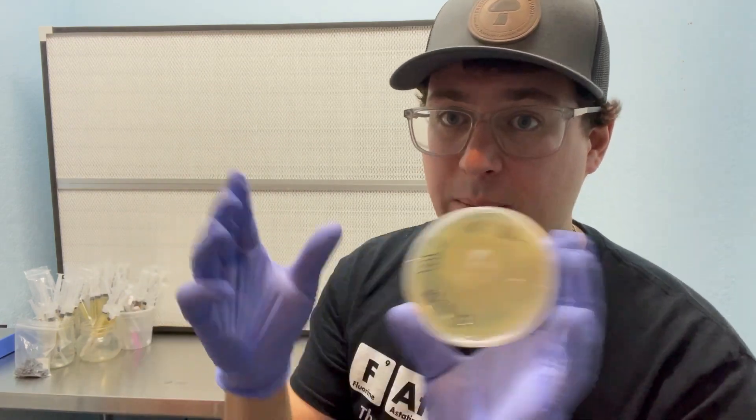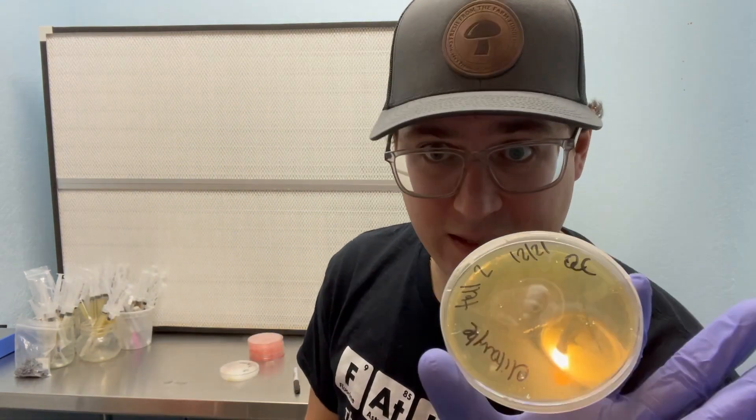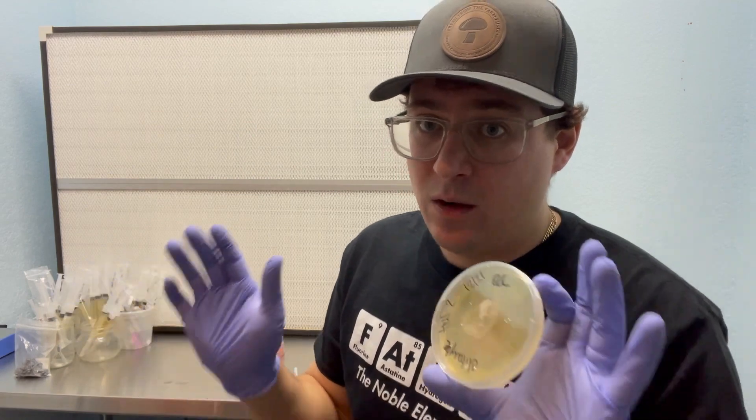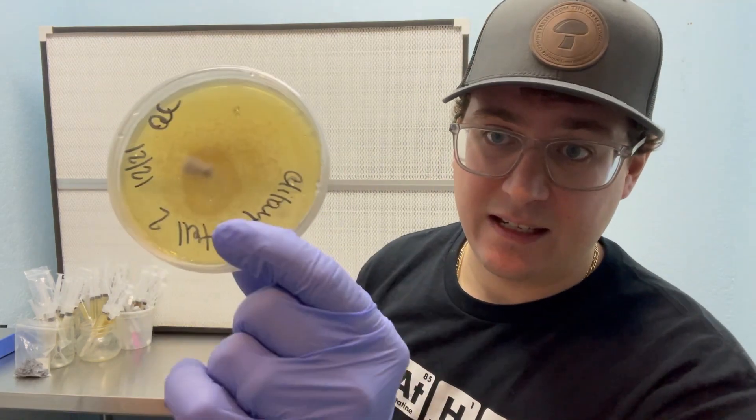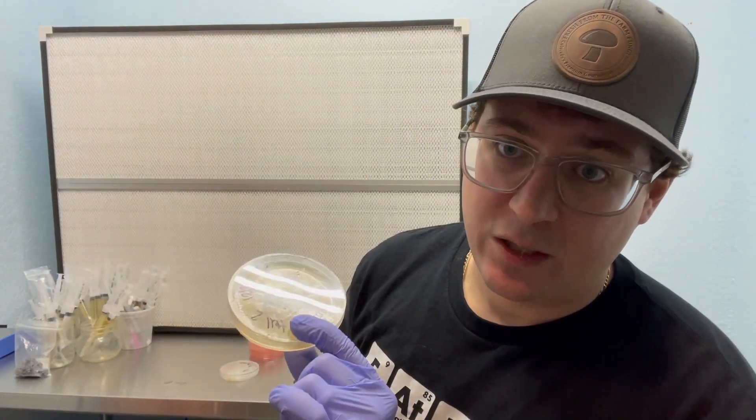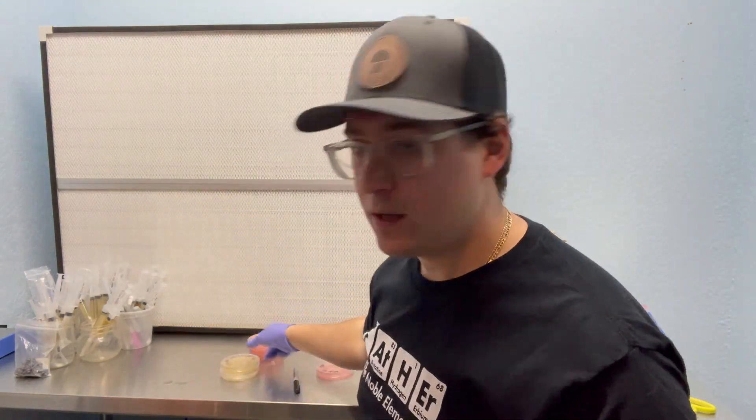It's always a good idea to have backup plates and backup slants. But this is worst case scenario. If you only have one petri dish left and you're trying to grow that mushroom or it's your favorite strain, don't be afraid. You can still save it. There's a lot of methods that you can do. But this is the easiest way, in my opinion, to save a contaminated petri dish. So I'll flip this around and go through my procedure on how to save this.